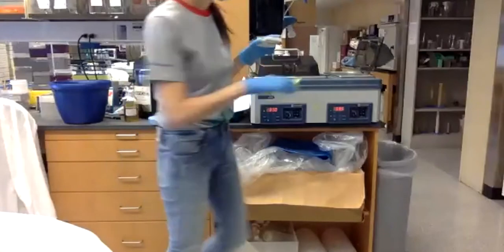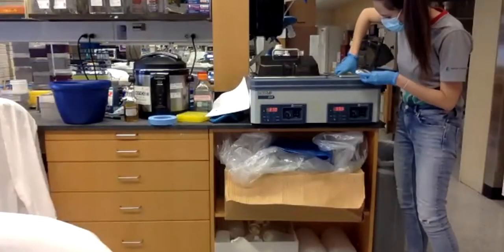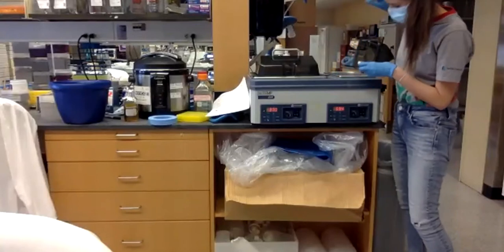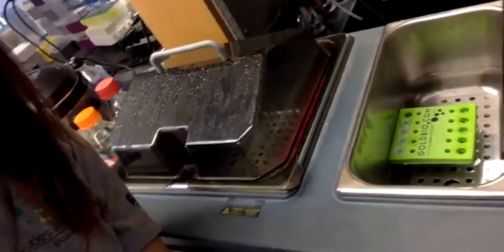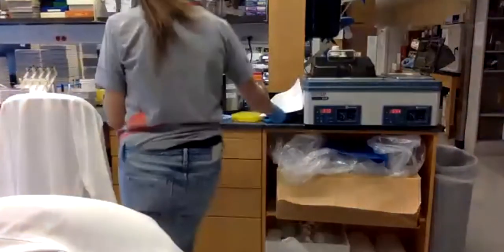I'll show you how it's floating. So it will take 50 seconds. And after that, I have to put it in ice.